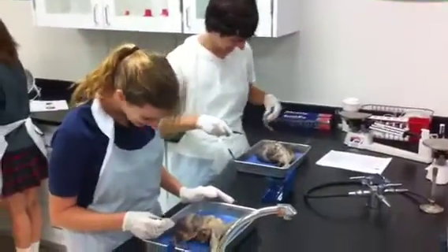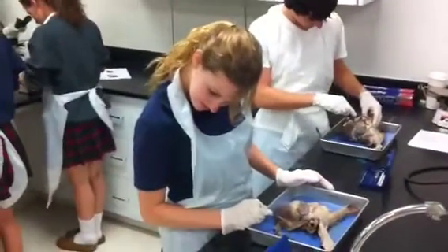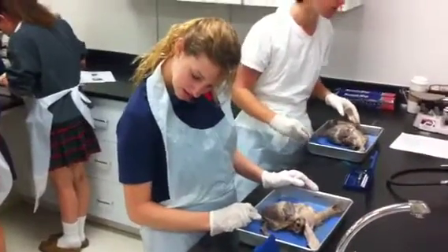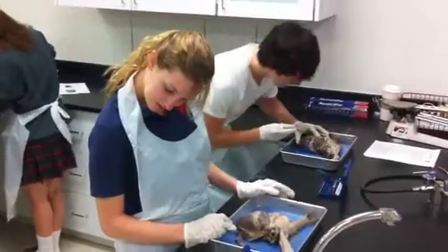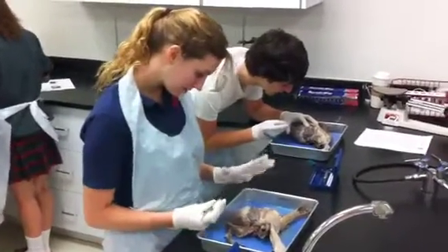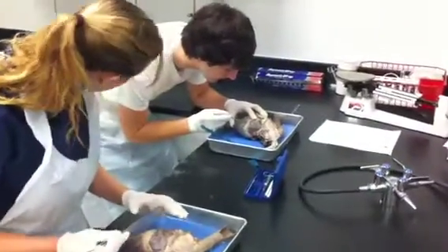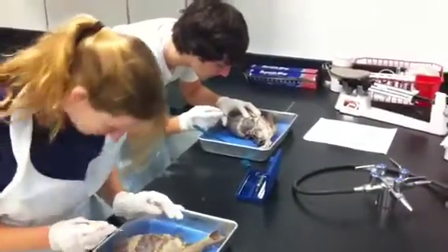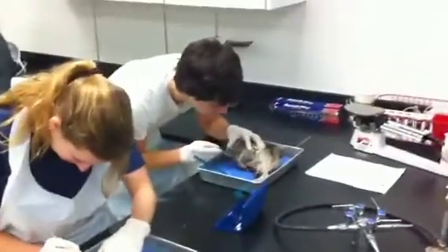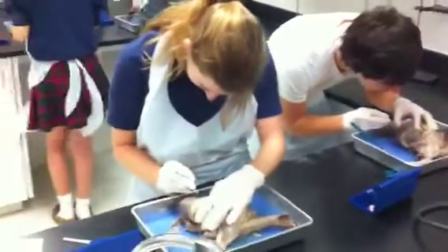So what are you supposed to do first? It says on the sheet. I don't understand it. Find the pericardium — grab it. You got the pericardium? Yeah, it's this one right here. I can't get a hold of it anywhere. What if my finger gets stuck? We'll cut it out — it'll just be all brown. Yeah, you're good.